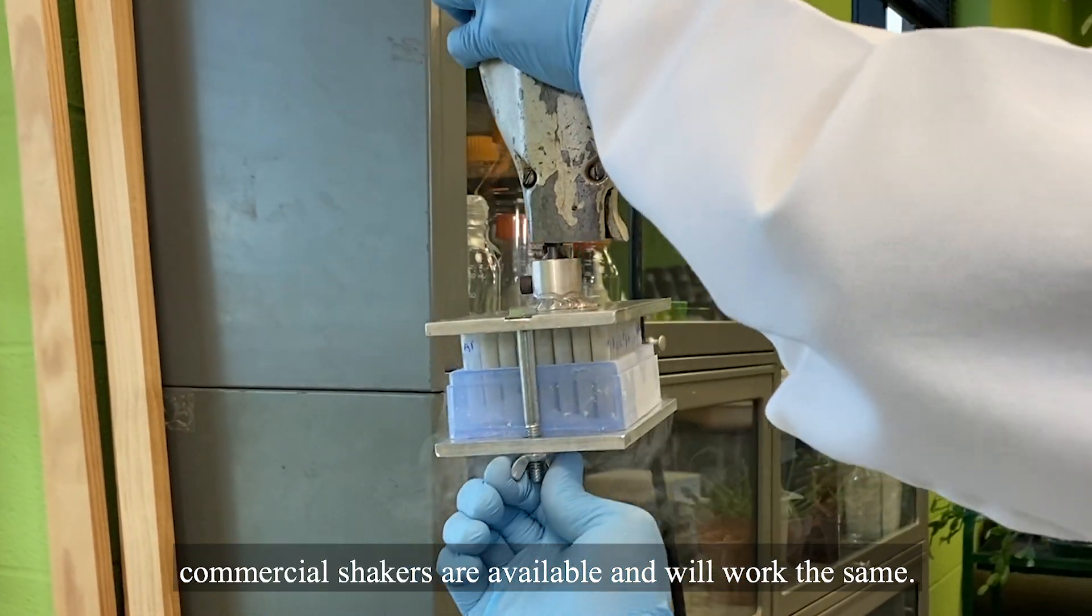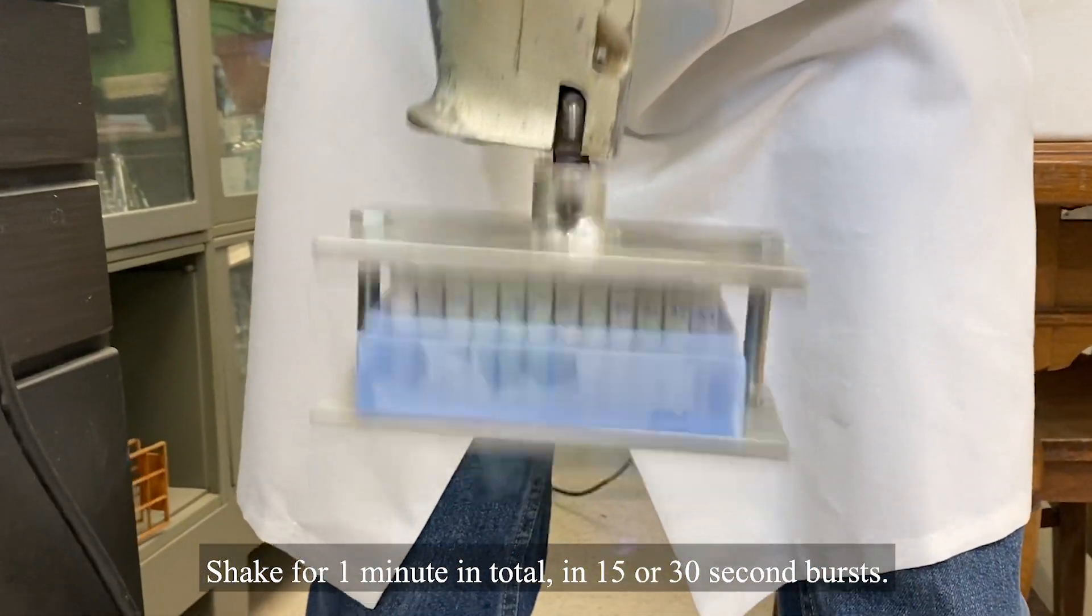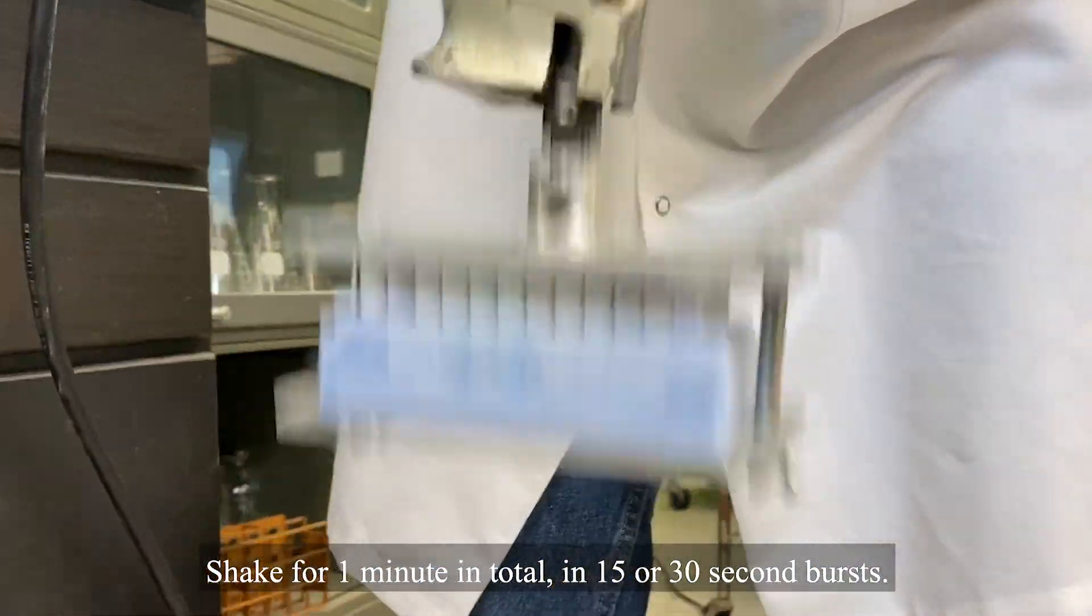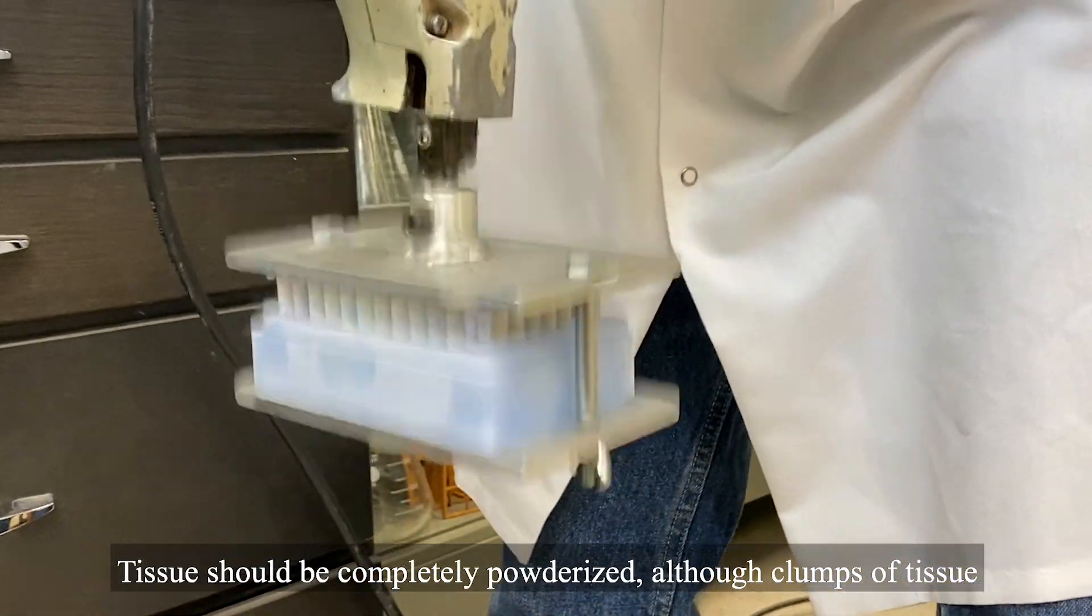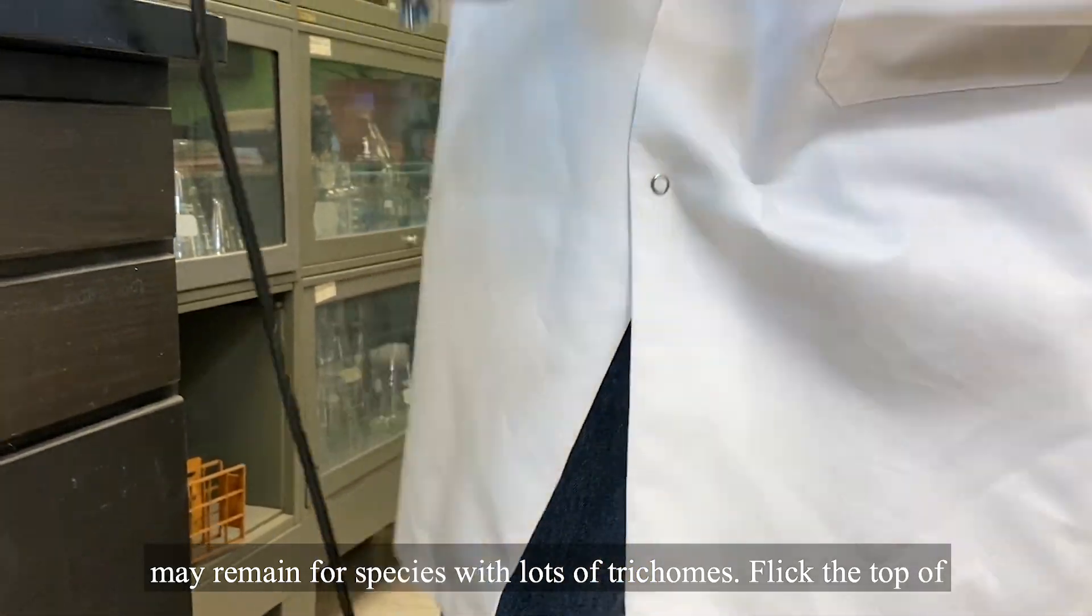Shake for one minute in total in 15 or 30 second bursts. Tissue should be completely powderized, although clumps of tissue may remain for species with lots of trichomes.